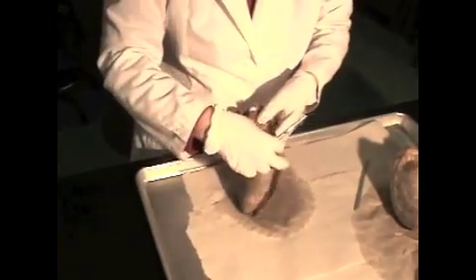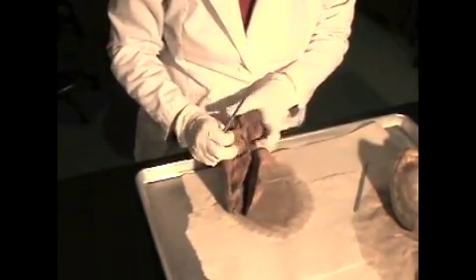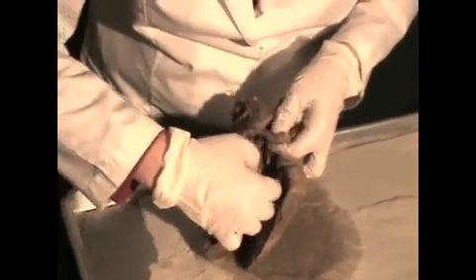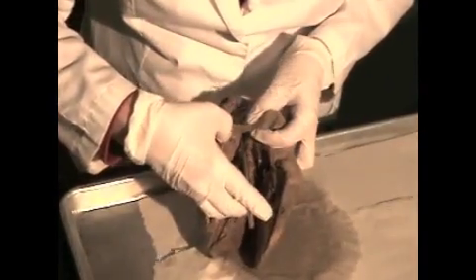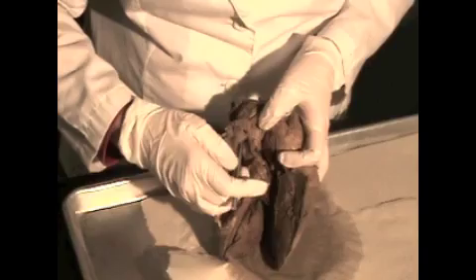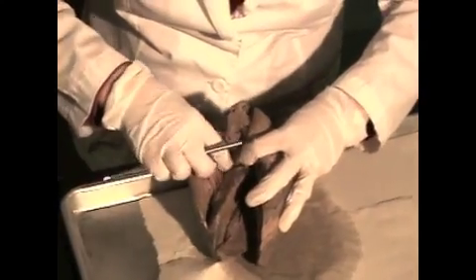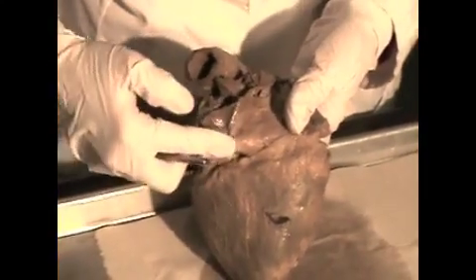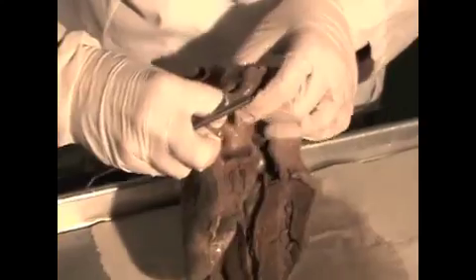cava, and opening up the right atrium, you would look for a very large hole, and I can stick my probe in that superior vena cava like so, and this is one of those hearts that has a superior vena cava not opened up. And then you would look for, below that, a large hole. That would be where your inferior vena cava, remember, which is parallel to that atrioventricular groove, comes in. And so you can see where that comes into the right side of the heart.